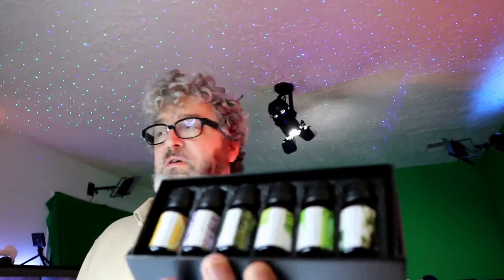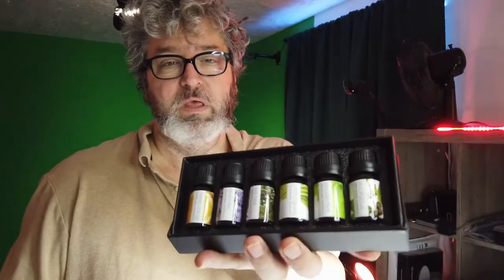Now, I also purchased 6 flavors of essential oils. We got sweet orange, lavender, tea tree, lemongrass, peppermint, and eucalyptus. We're going to be able to test 5 of these to make sure that this is a multifunction device as it claims. So we're going to run 5 tests. I have 10 petri dishes.